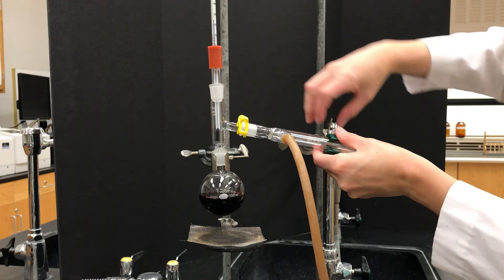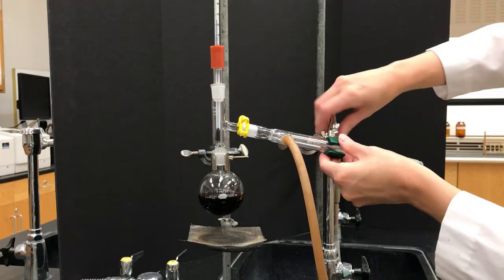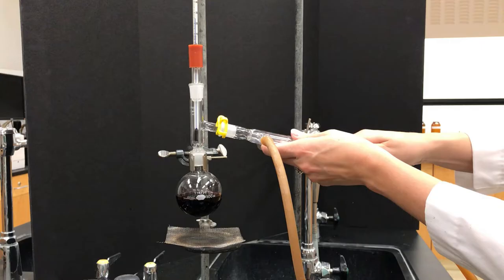My goal is to have the thermometer completely vertical, so you do want it to look nice. Once you've got the angles correct, then you can clamp it down and make it a little more secure. Everything probably takes a little bit more adjusting.